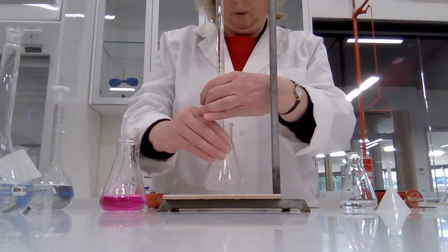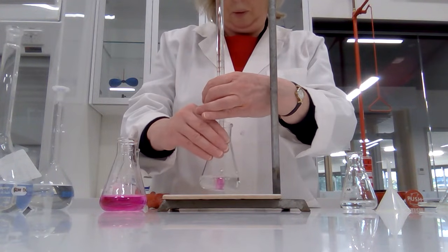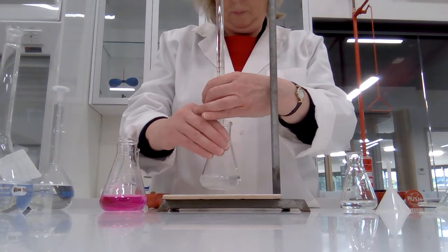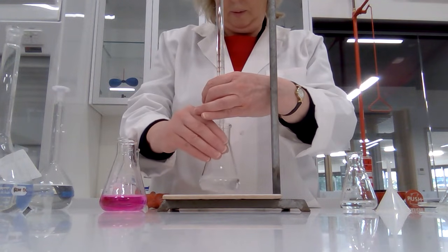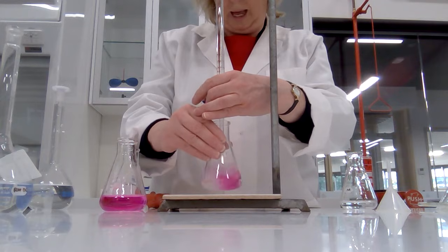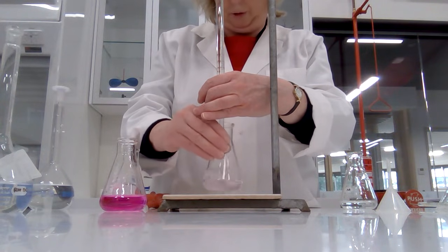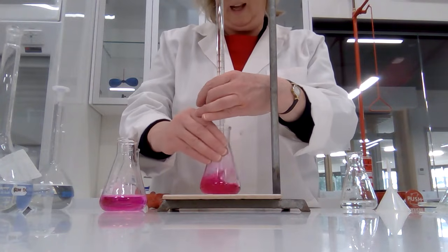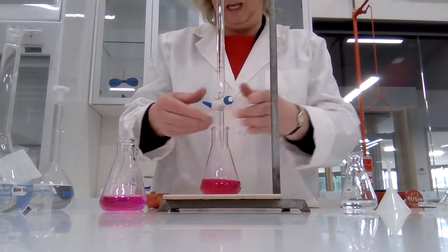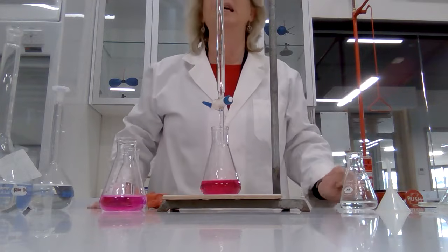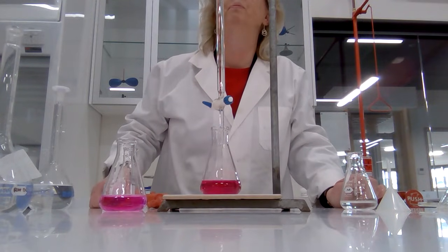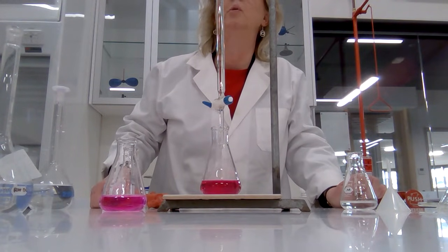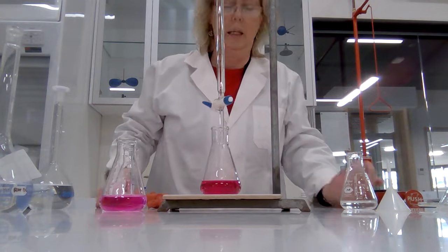Whoa, all good. And, oh, we could be in luck here folks. So let's just go for one little, oh. Okay, and that's how you go over the end point. And I have messed that up enormously. That is 20.80.